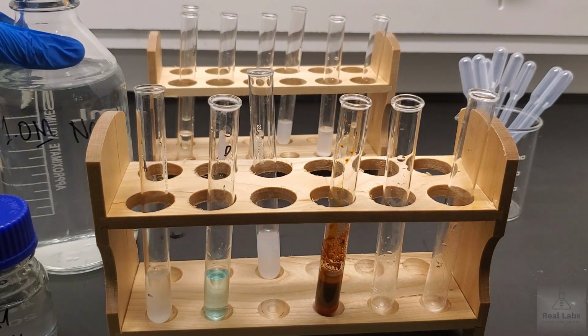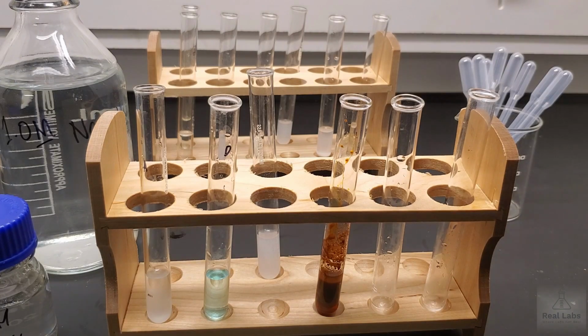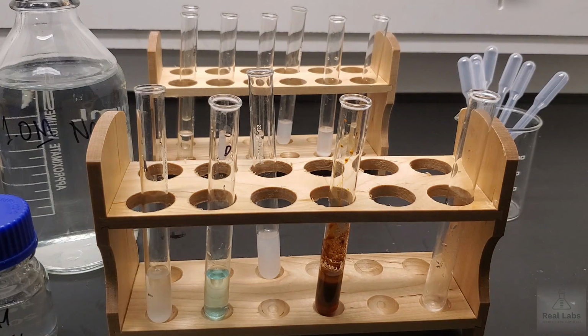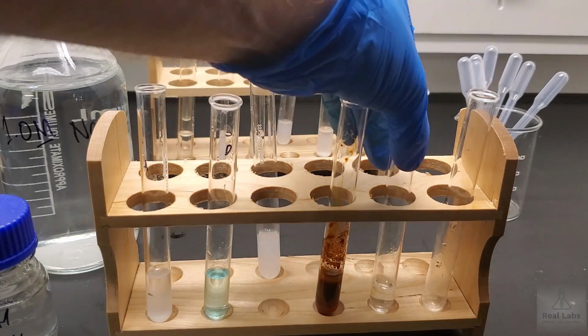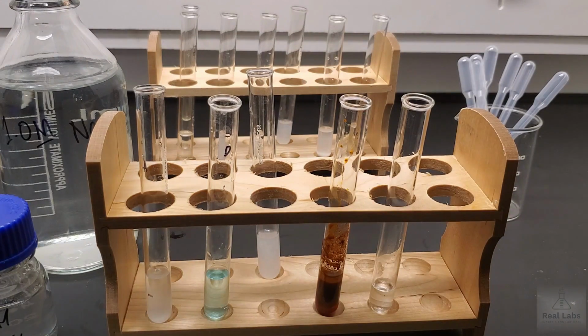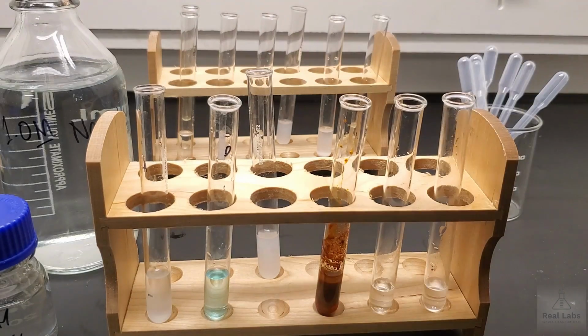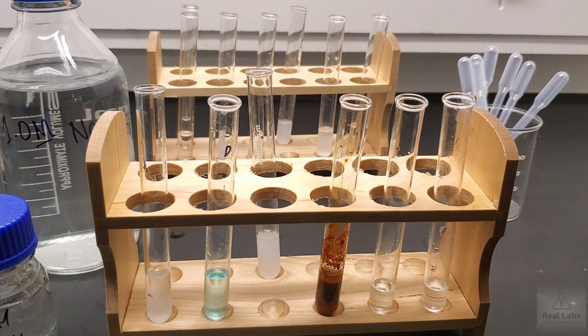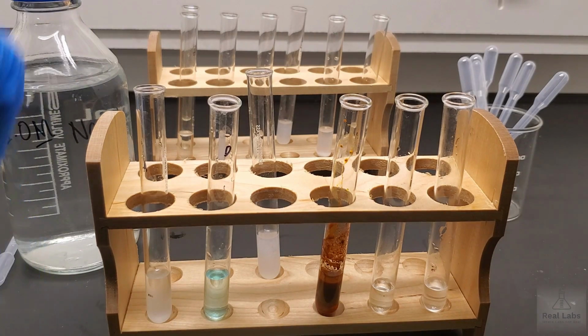So the first thing I'm going to do is, since I'm going to run both of these back to back, simply use a clean pipette to make sure my pipettes are not the problem. And I'm going to add 1M sodium hydroxide. This is a little stronger, so if there's a reaction, we'll definitely see it. I'm just going to add that to both of these test tubes at the same time, since we're going to be running that pretty much in parallel. Then we'll do them in order. We did the hydrochloric acid first, so we'll do that one first here as well.